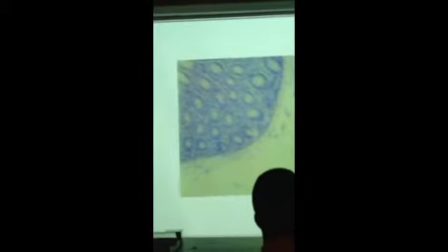Okay, again you've got the submucosa, which we see here, deep to the mucosa. And then again, we're going to have the muscle layers, the muscularis externa. There are two muscle layers, as there were in the stomach and in the small intestine, but even on an inner layer, the circular layer is intact around the organ. The outer layer is not. The longitudinal muscle layer, instead of being all the way around the organ like we saw in the stomach and small intestine, is just in parallel rows.